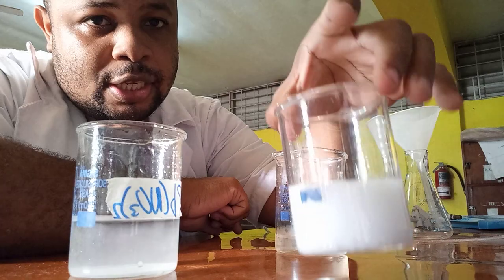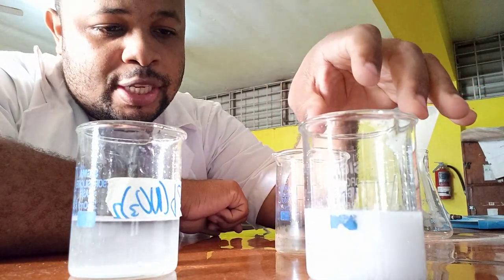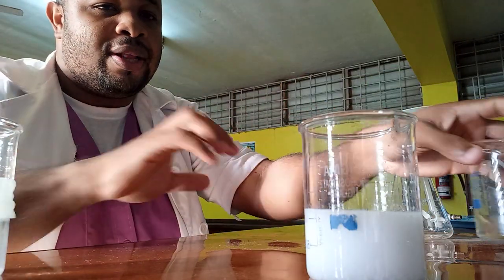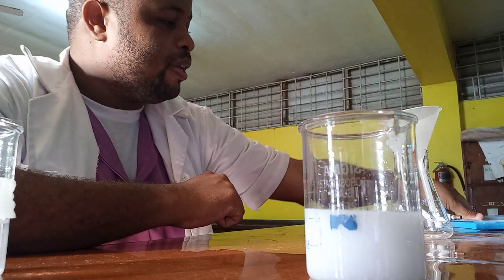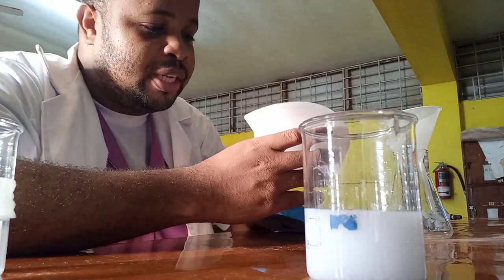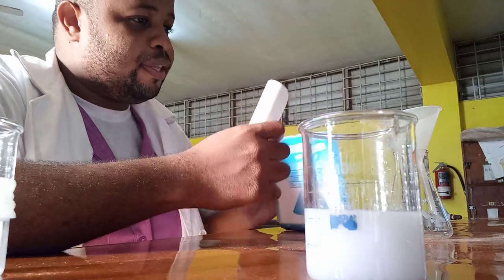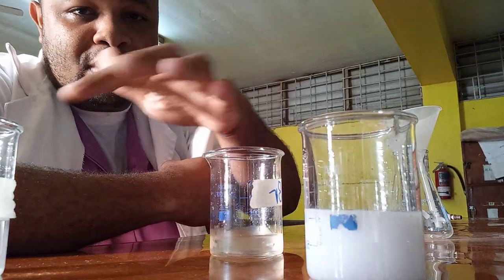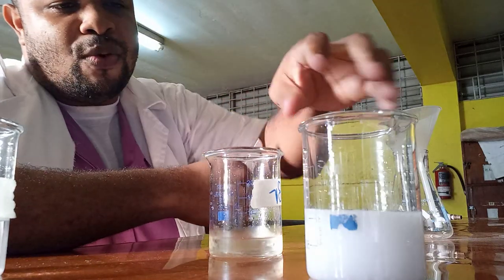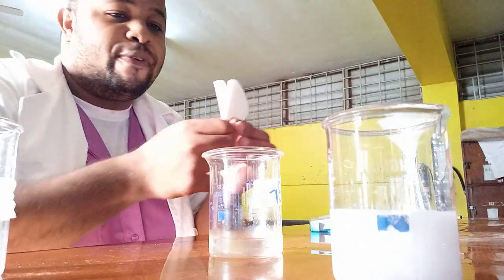So now inside this beaker we have a mixture of lead bromide and potassium nitrate. If we want to obtain our lead bromide — because it is insoluble and the potassium nitrate present is soluble — we will filter the mixture. After mixing the two solutions of these soluble salts we get a white precipitate of lead bromide, and now we are going to filter it.